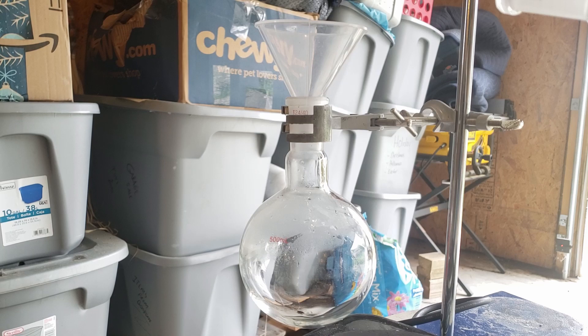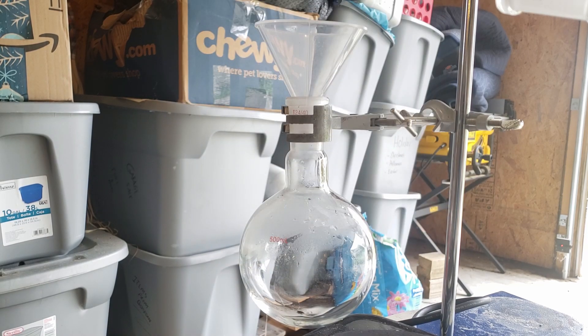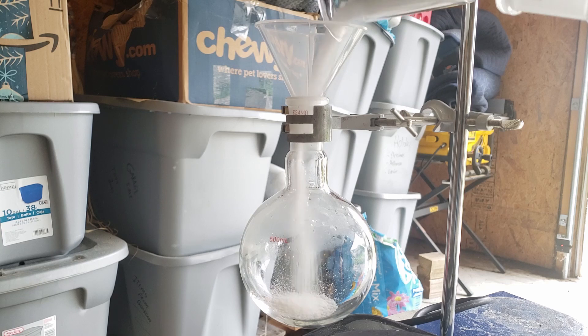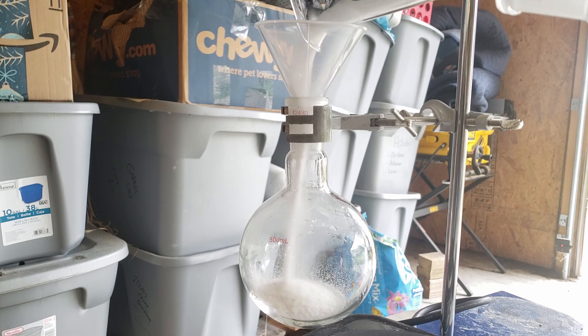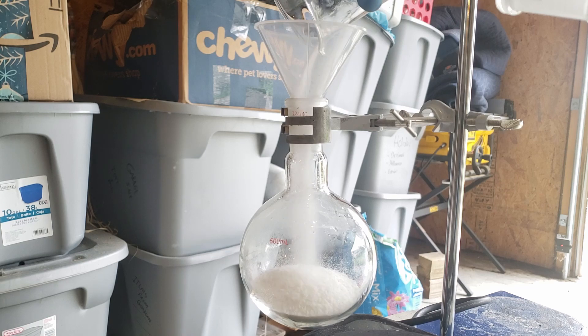I then added the two chemicals to a 500 milliliter round bottom flask. You can't wash off any remaining powders from the beaker or the funnel using water, since all of the water will end up in your product, so I just had to scrape these off with a stir rod.